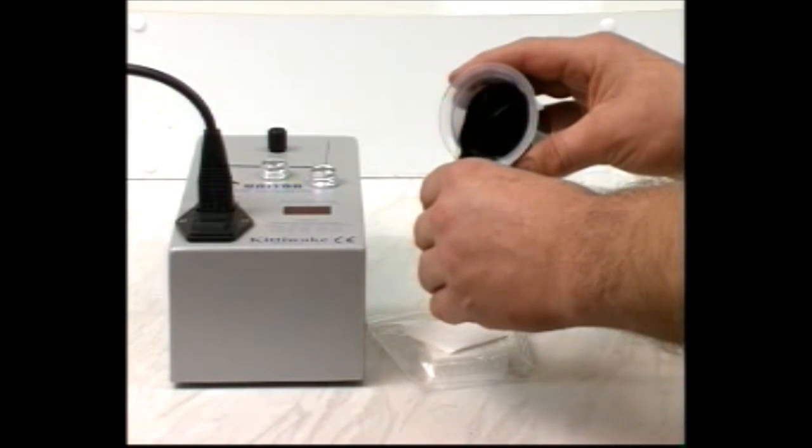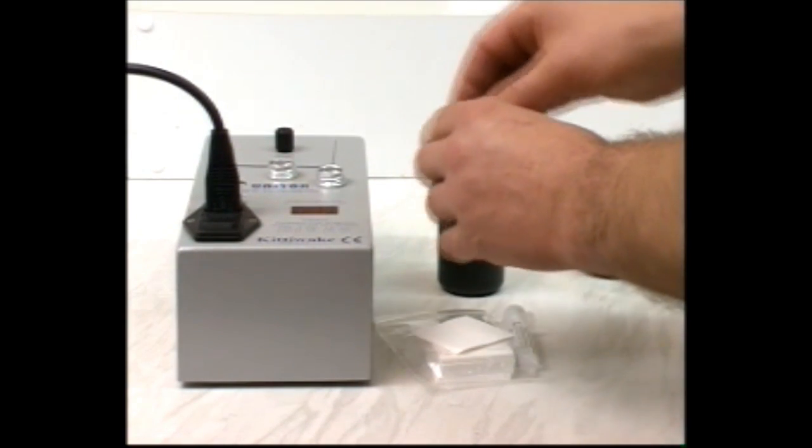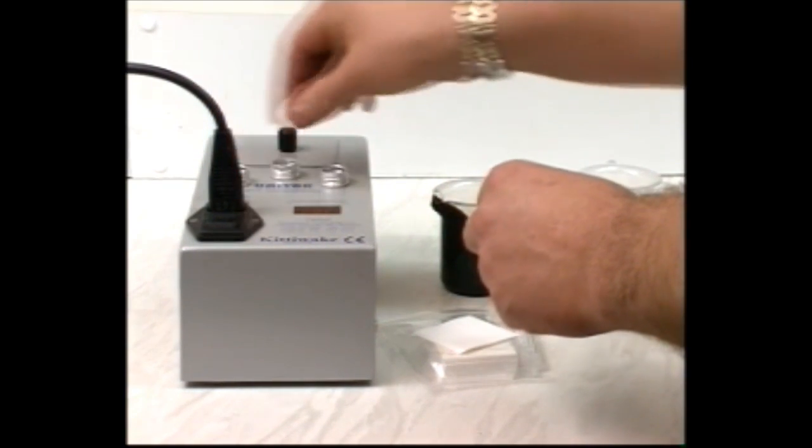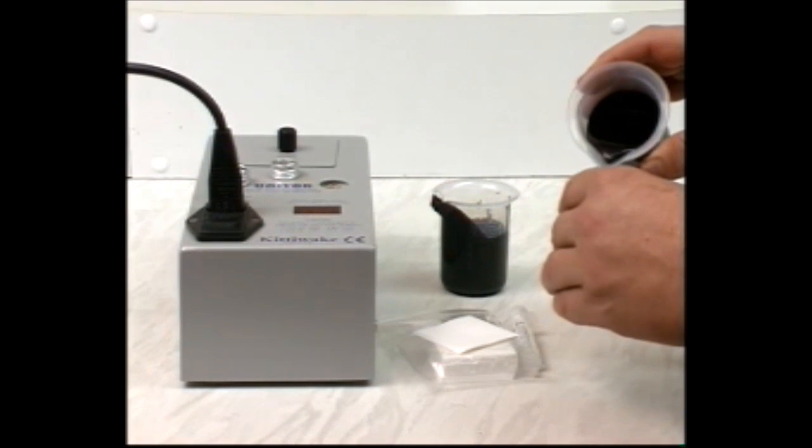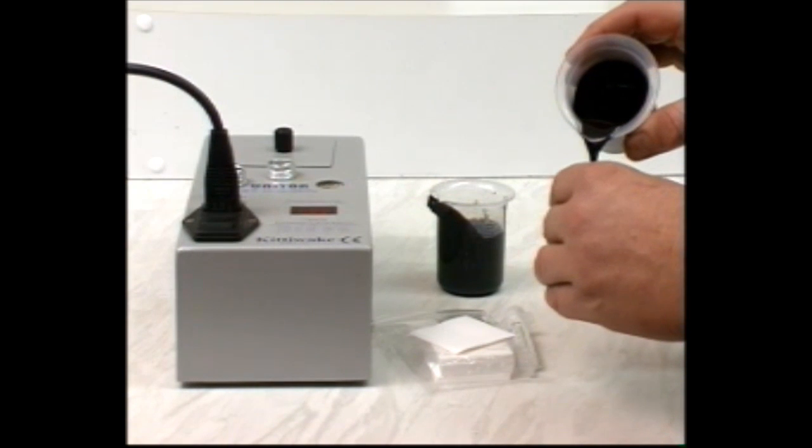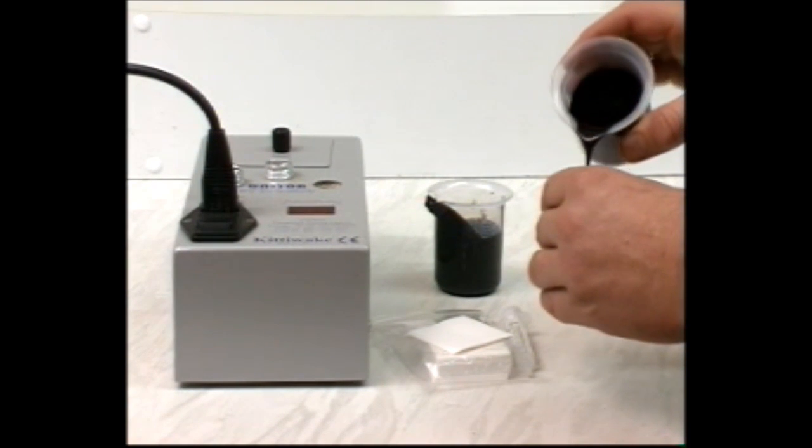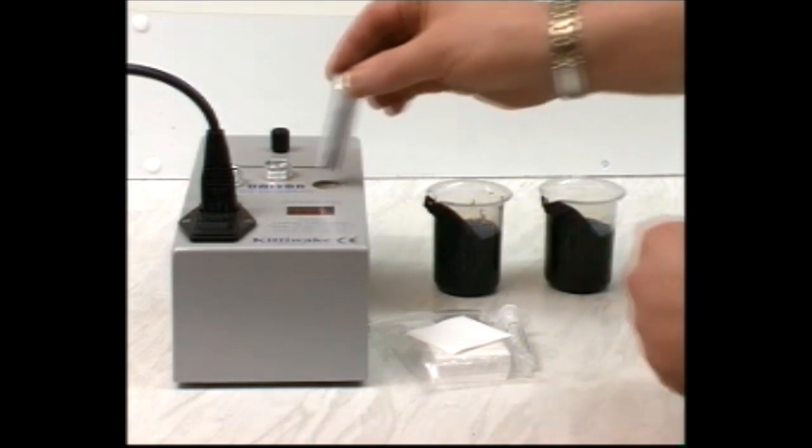To find if two fuel oils are compatible, first repeat the sample preparation procedure used in the stability test. Take two fuel samples and place in the preheat holes of the fully heated unit. Press reset and leave for five minutes.